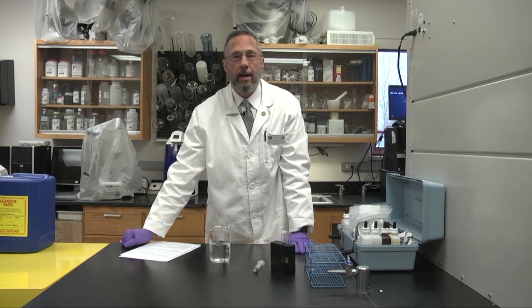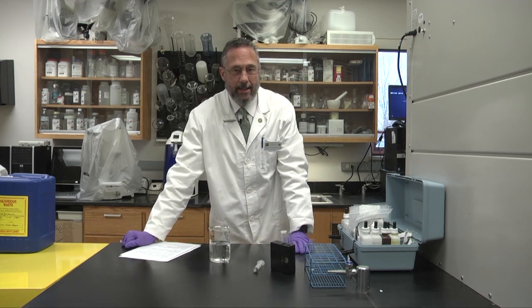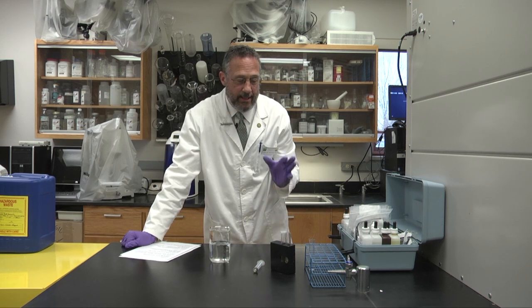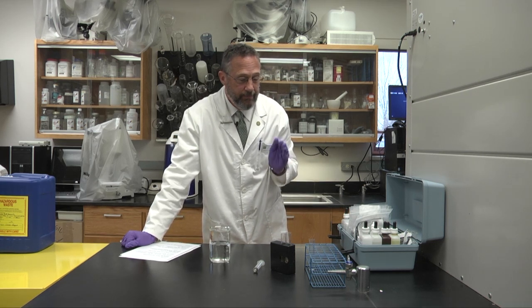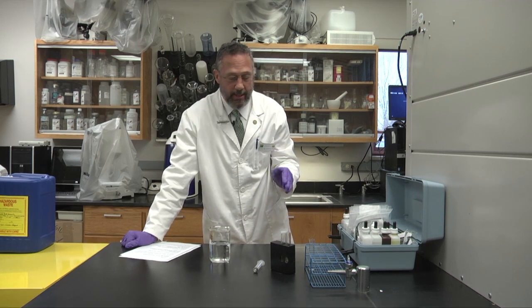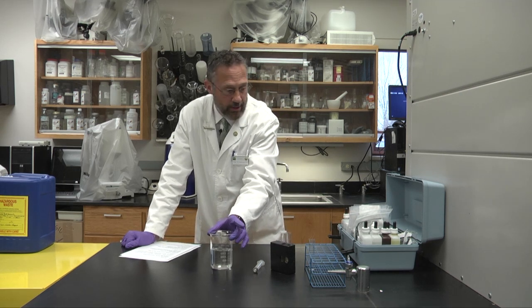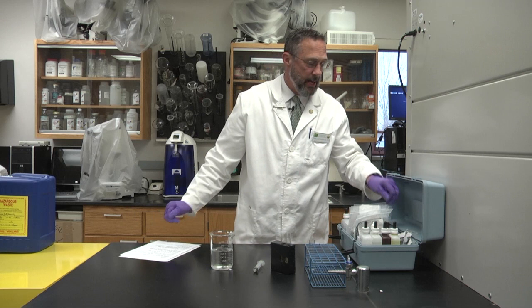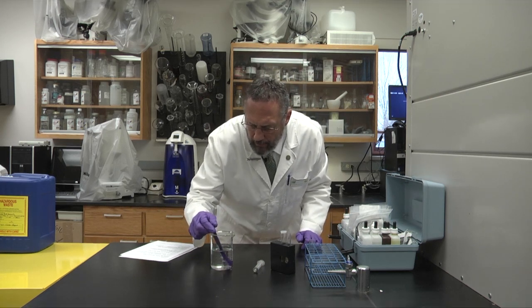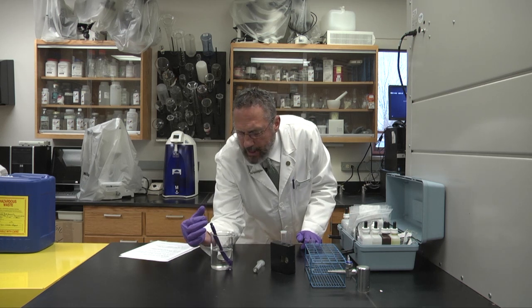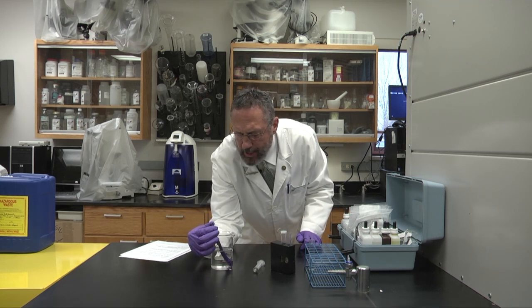Now there is also the most crucial step here is to calculate the toxic ammonia and in order to do that we need to check the pH and temperature of this water. And then we will refer to a table and we'll get a number from the table based on the temperature and pH readings.